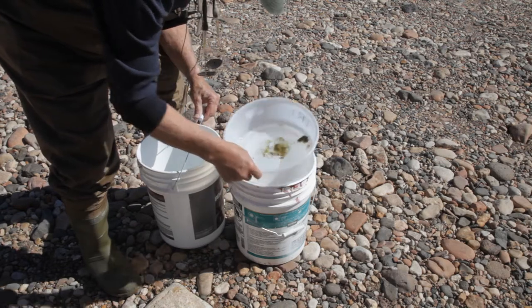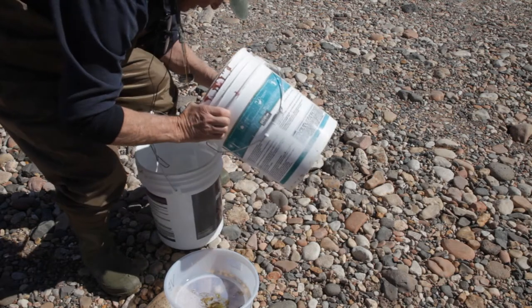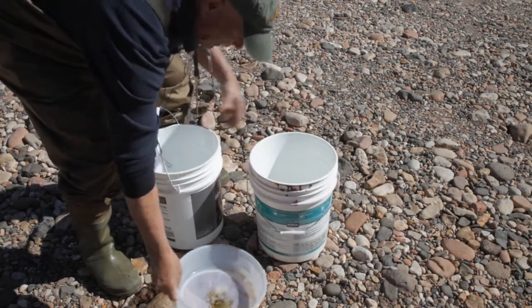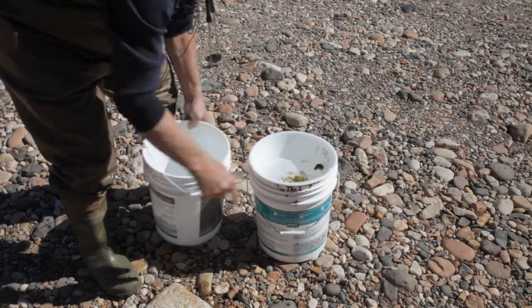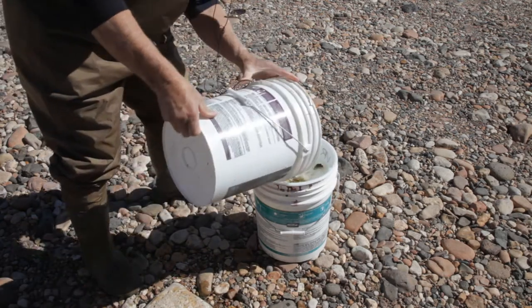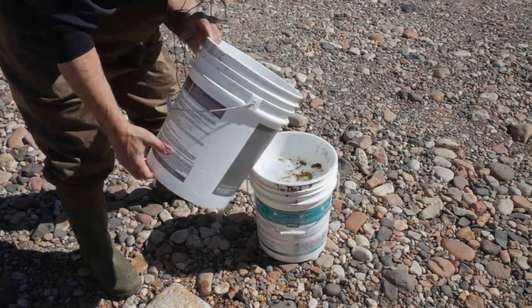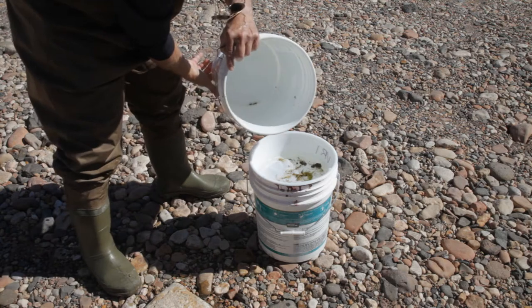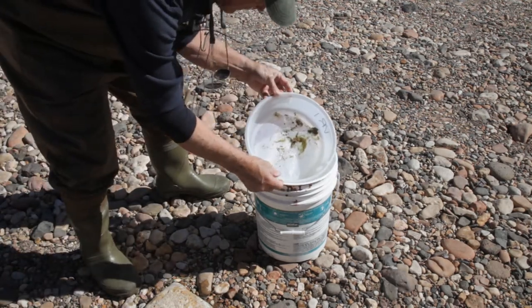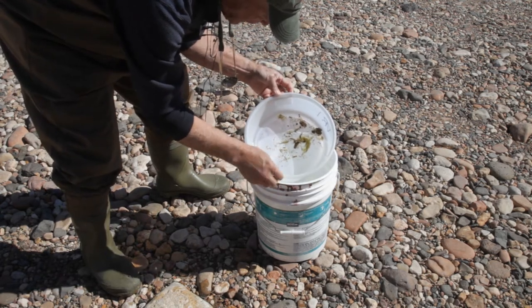I can see a lot of them swimming around in there. We'll need a little bit more water in here just to wash it out, and obviously we'll wash that through the sieve also. We'll do that until we don't see any more critters left in the bucket. So now all of our collection is in here — we can see several things swimming around.